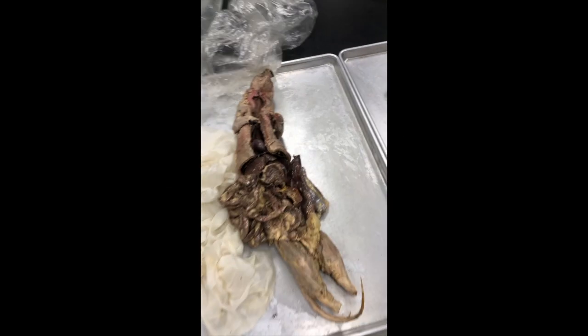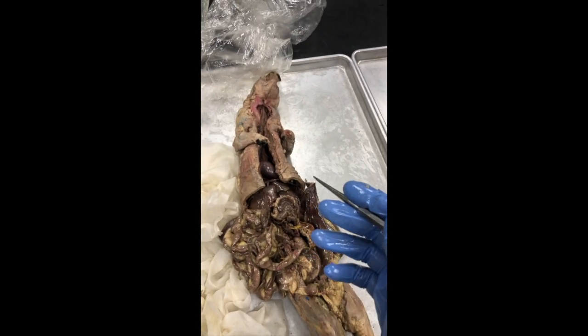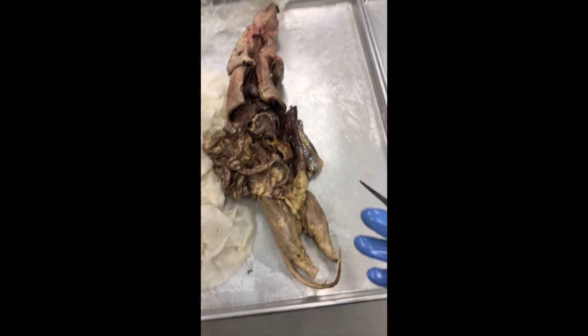All right, guys, so this might be a complete and utter disaster, but I'm going to give it my best. I'm going to try and demo to you where all the structures are one-handed as I hold my phone and read off the list here. So I've got two minks right here. Both of them are male.